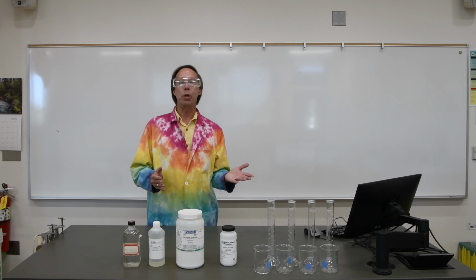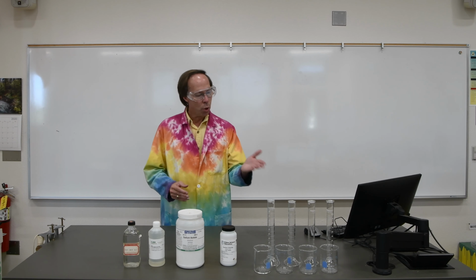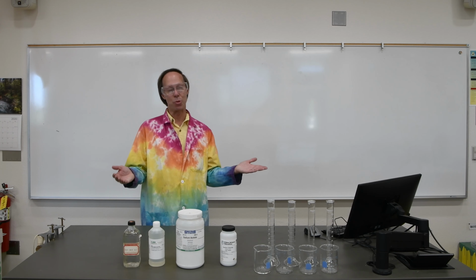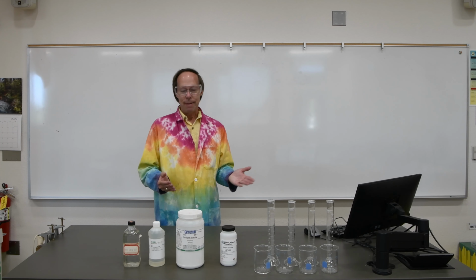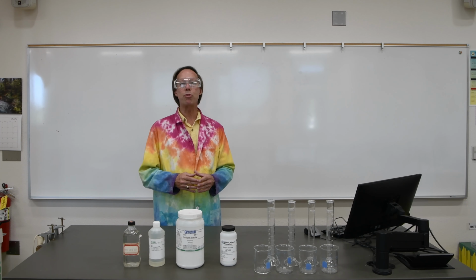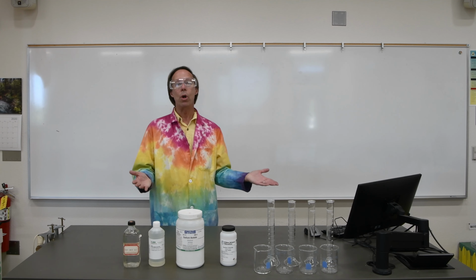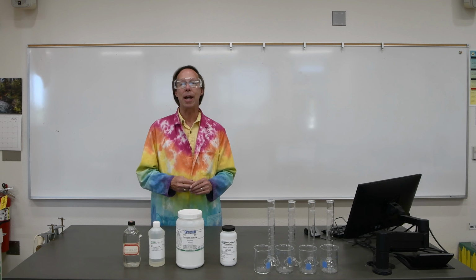Normally, when we do this experiment in person, we would get groups of 4 students, and each of you would make 4 of the 16 solutions. Of course, I'm here by myself today, social distancing, so I'll be making all 16 of those solutions. Now, when you do the experiment online, your instructor may have you split up the work, the calculations, so that each of you is doing only 4 of those, or they may have you do all of them yourselves. That'll be up to myself or whichever instructor you happen to have when you're taking Chemistry 3A.